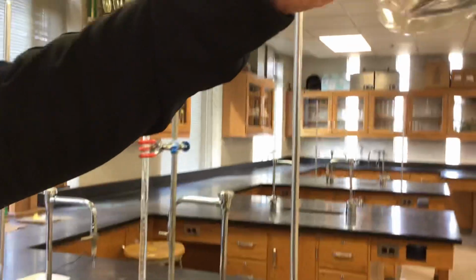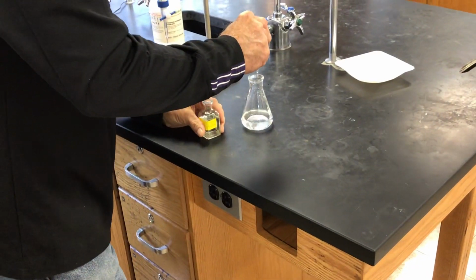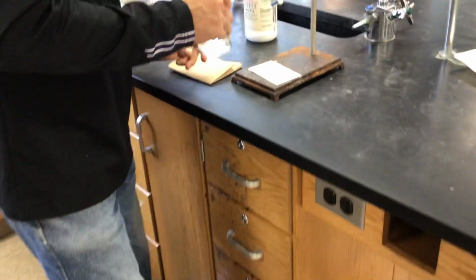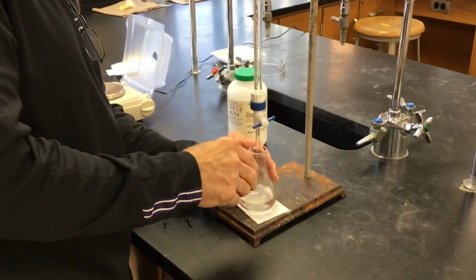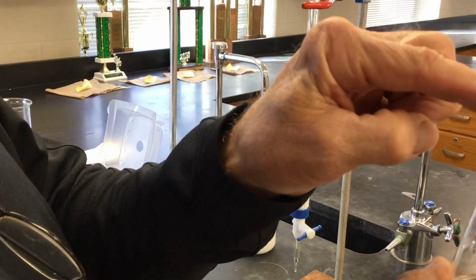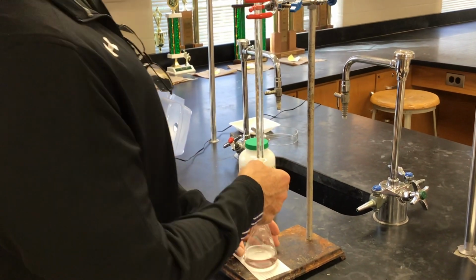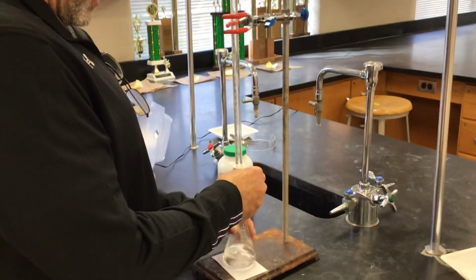Okay, Mr. Moore, I'll ask you again. I think you got it. I don't see any solid in there. All right. Here we go. All right, remember that last burette reading becomes the initial burette reading now. Is that powder stuck to the side here, or is that just water drops? I see just water drops. Okay. I don't see any powder. Okay. We're at just about 6, so I should be able to go down to 8 for sure.